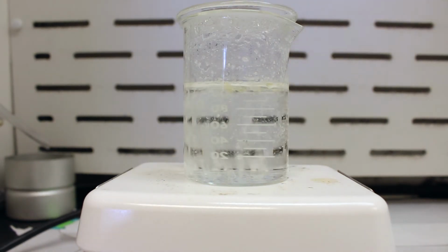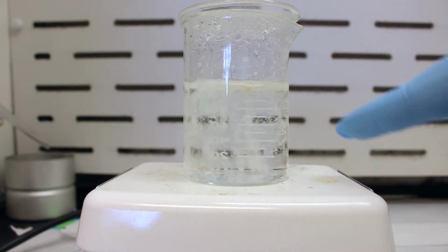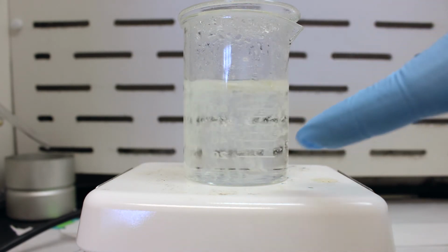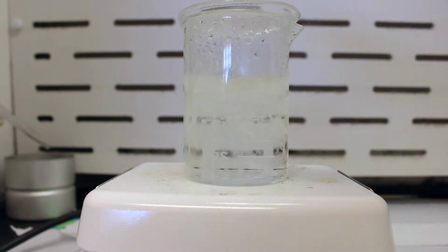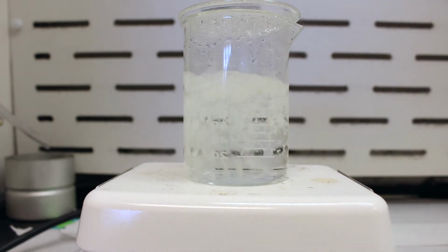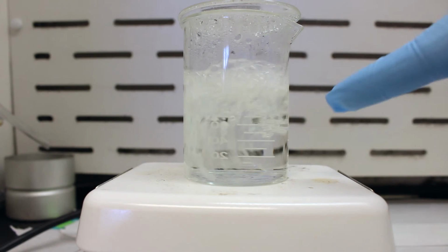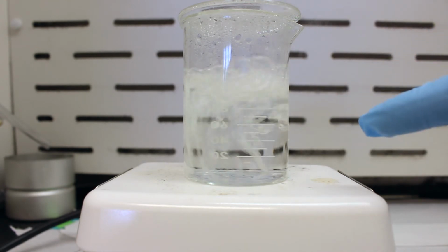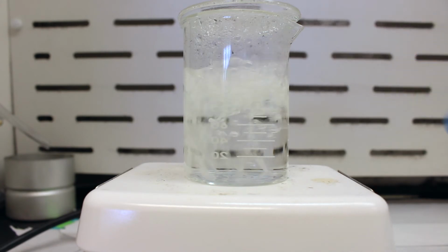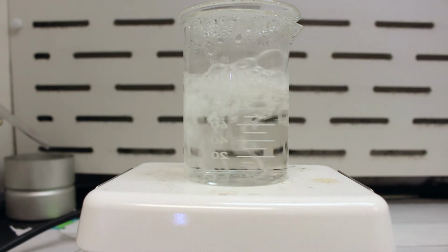Alright, so we've heated our mixture up to boiling, and as you can see, most of the solid is dissolved, but now we've got some oil here. Before it starts boiling too vigorously, I think I will turn off the heat there. That should let it calm down a little bit. You may have seen, though they've kind of been obscured by the bubbles, there were some droplets of what looked like an oil, and that's something we see a lot with this lab. And we think it's maybe the solid that starts to melt actually in the water. But it shouldn't affect the recrystallization too badly.